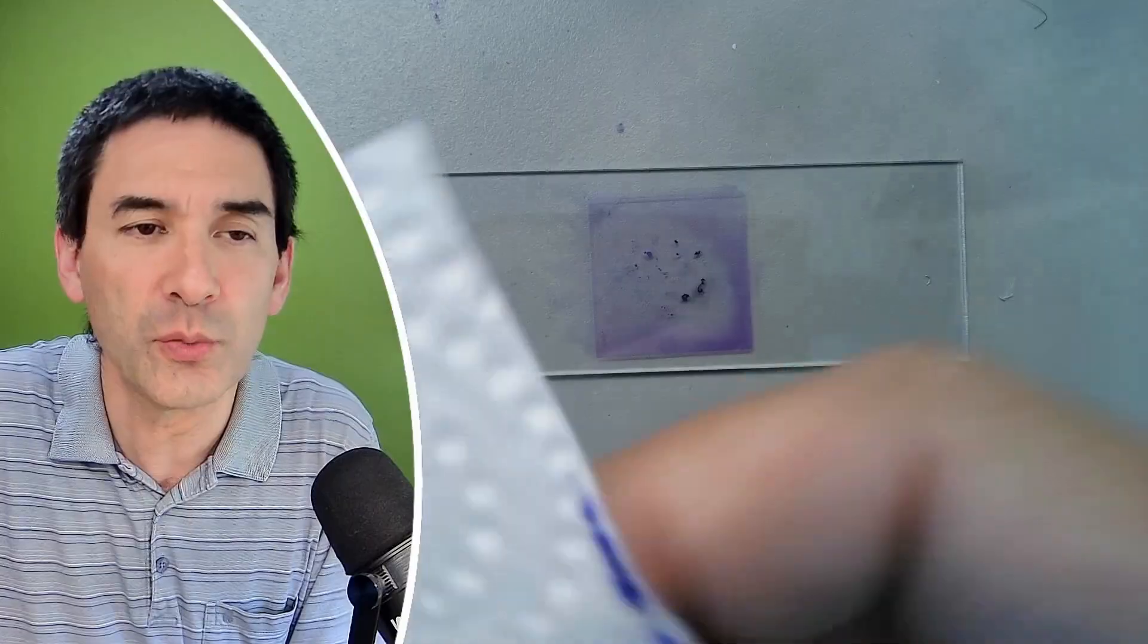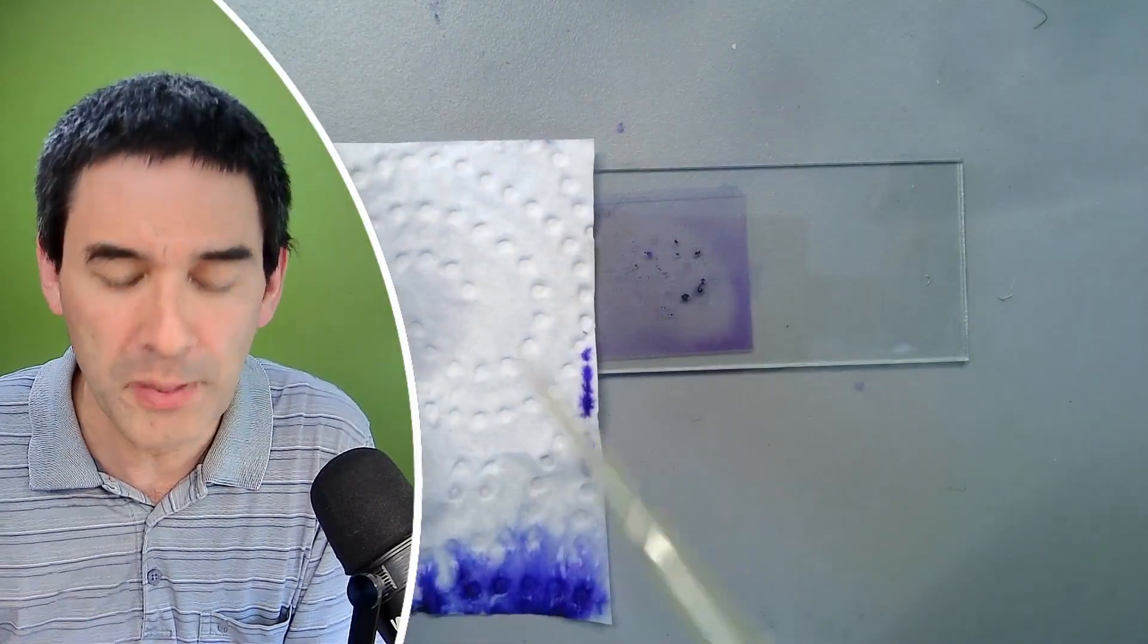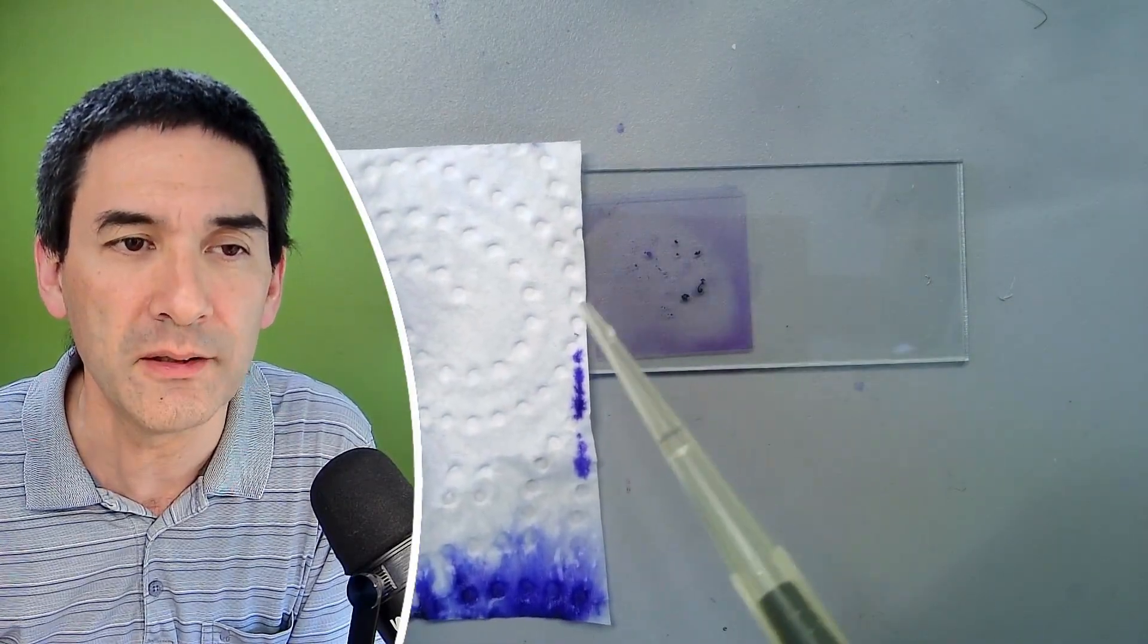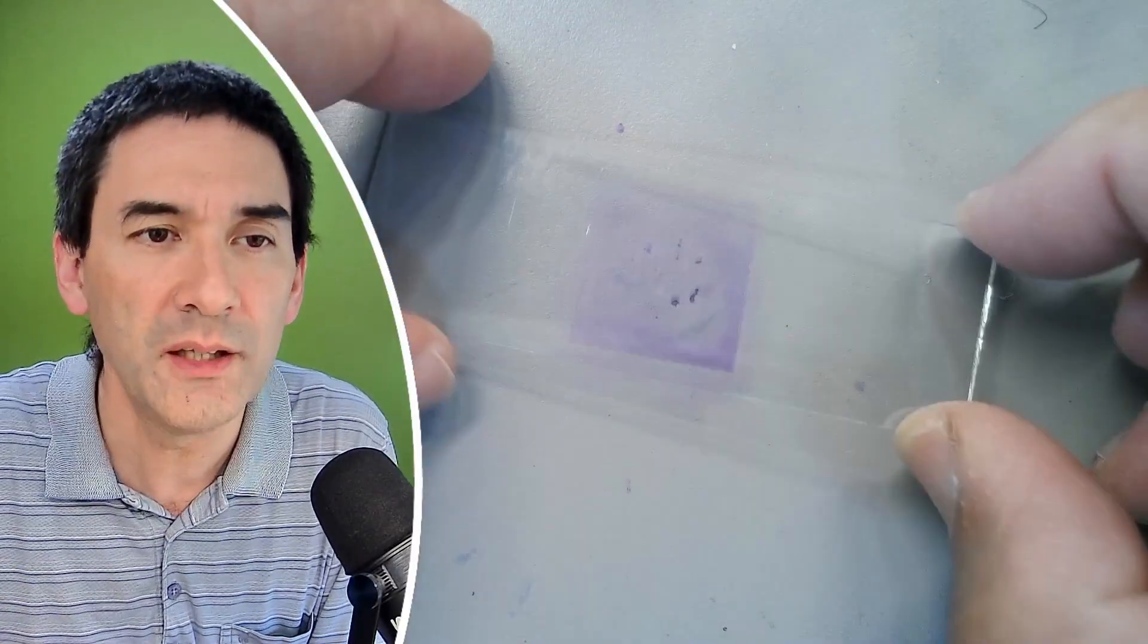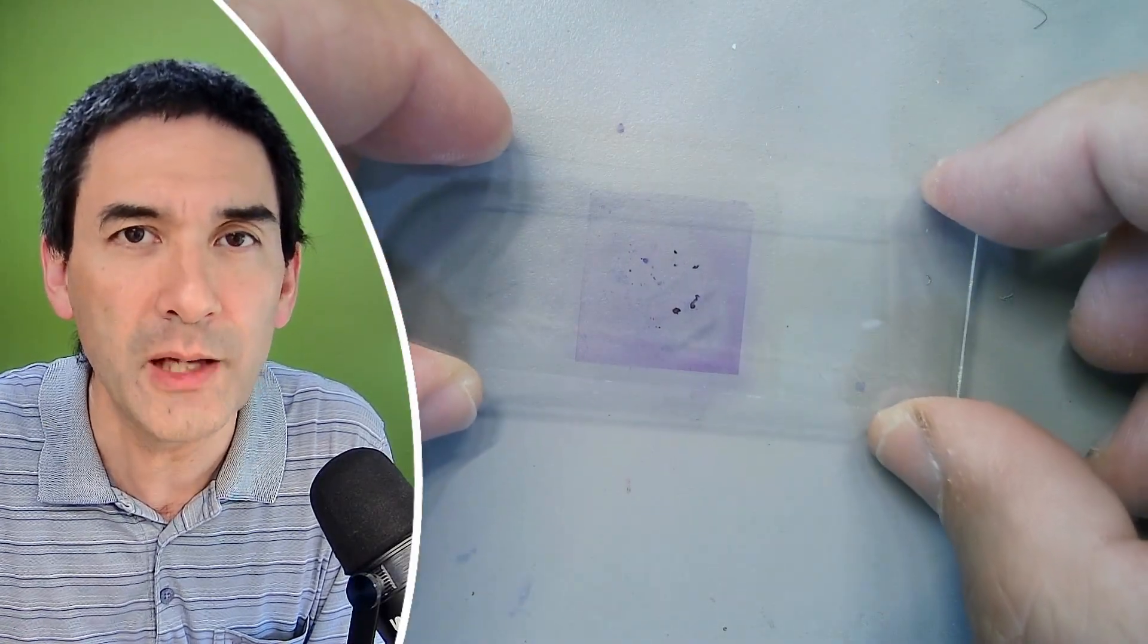Just for clarification, I was just holding the filter paper with the tip of the pipette. But you can also use your fingers if you want to. So and this here goes again under the microscope.